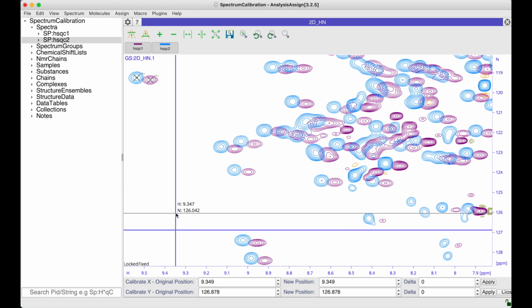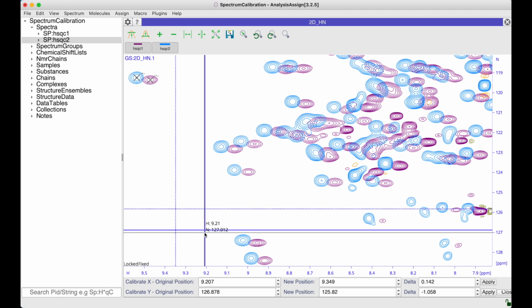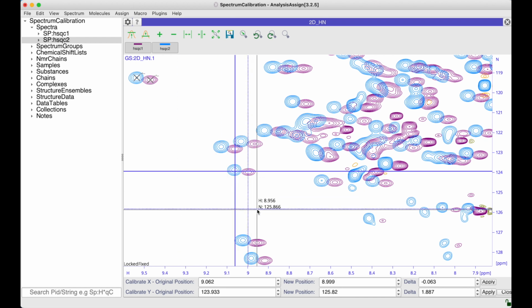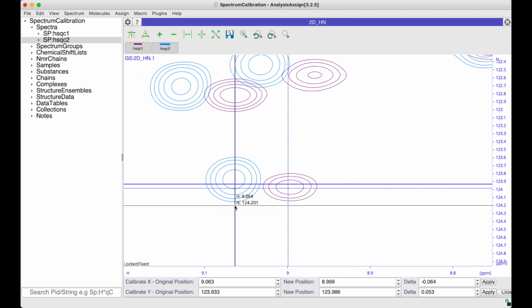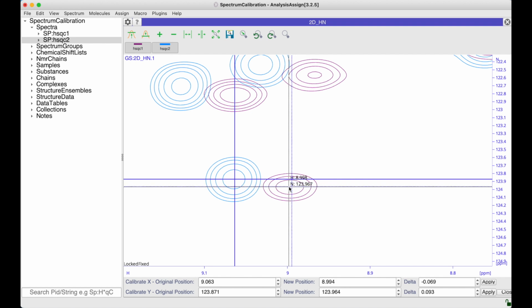In a moment you can see that these lines actually are two lines on top of each other. So you've got bold lines which specify the original position, and you've got these dotted lines which specify the new position. And you can either move these lines interactively, or you can specify the values here in these spin boxes. So I'm just going to zoom in on these two peaks here, and I'm going to specify that the original position of this blue spectrum is here, but really where I want it to be is this new position where it's exactly in the same place as this purple peak.